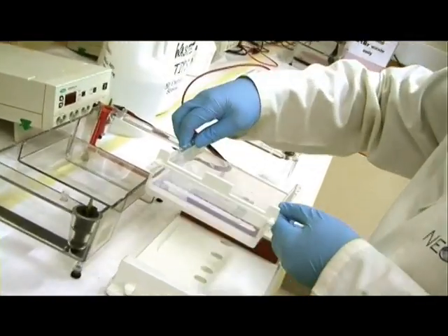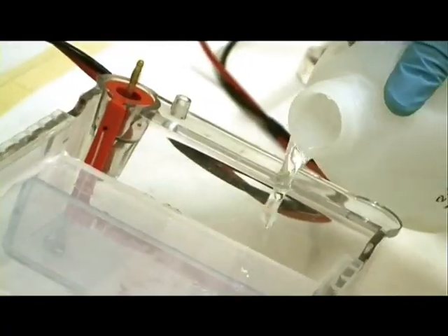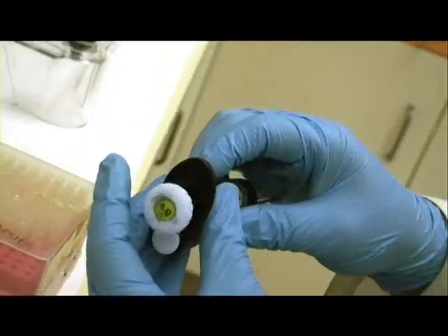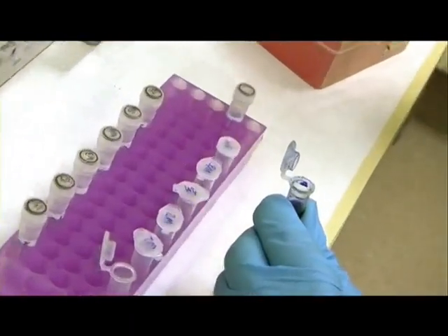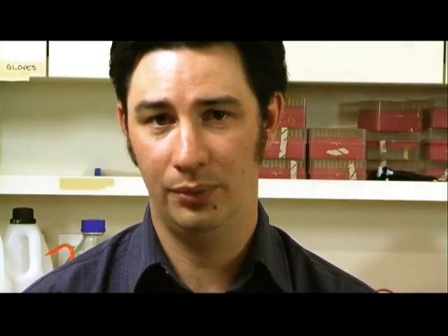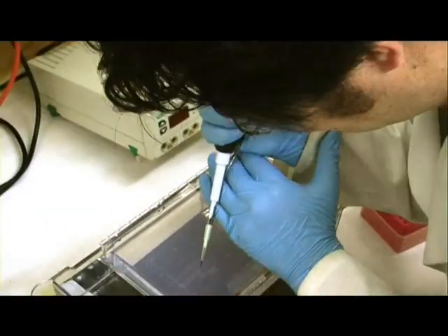Once the gel is set, the gel tray is placed in a buffer tank. The buffer tank has electrodes at each end, and the gel tray is positioned so that the wells are at the same end as the negative electrode. Running buffer is added — the same buffer that was used to make the gel — which allows electrical current to run through the system. We now load our DNA samples, first mixing them with loading dye, which is a dense blue solution. The density ensures that the DNA sample will fall to the bottom of the well, and the blue dye allows you to track the progress of the electrophoresis. We also load a molecular weight marker, or ladder, which is a set of commercially available DNA fragments of known sizes that will allow us to estimate the size and concentration of our DNA samples.